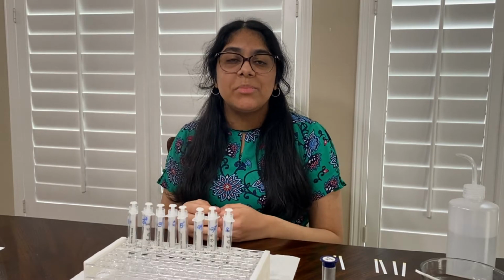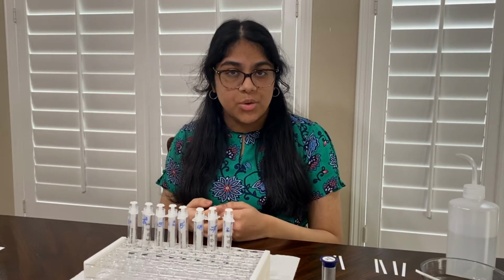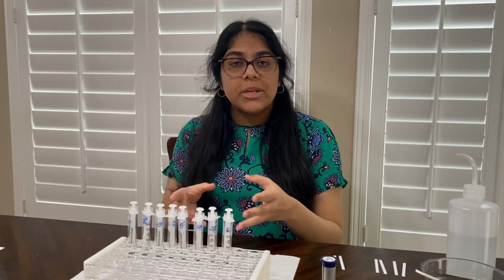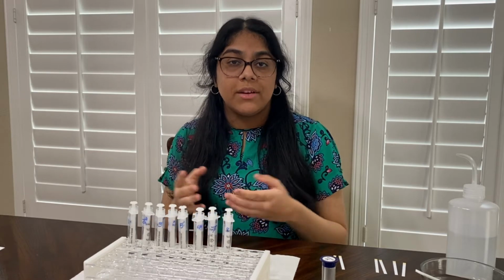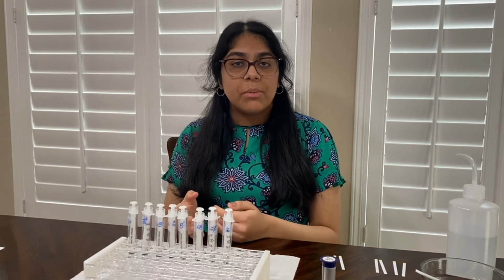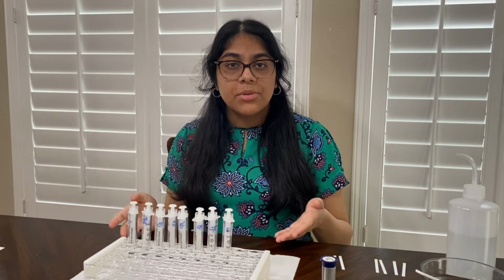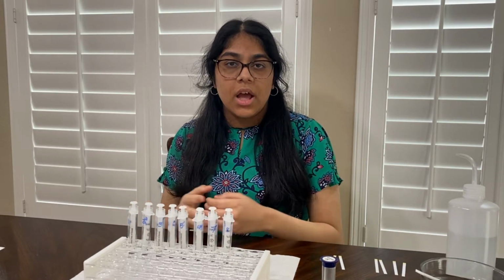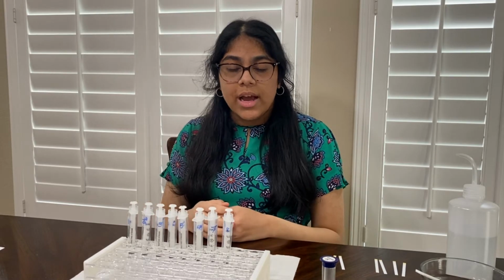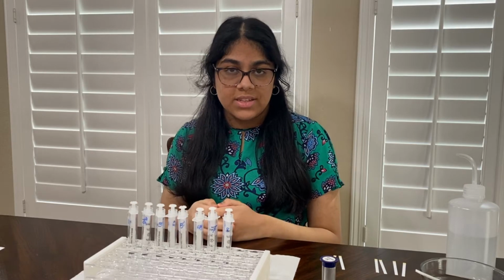So today I'm going to be demonstrating 3 group testing methods, and the first one is called the Dorfman method. For this, we're going to be testing 8 individual samples, and one of these samples is going to be an infected sample. And I'm going to represent this using a clear glucose solution. For the other 7 samples, they will be non-infected, and I will just be representing these using some distilled water. Now I'm going to fill in the individual samples, and I've selected one to serve as the infected sample.